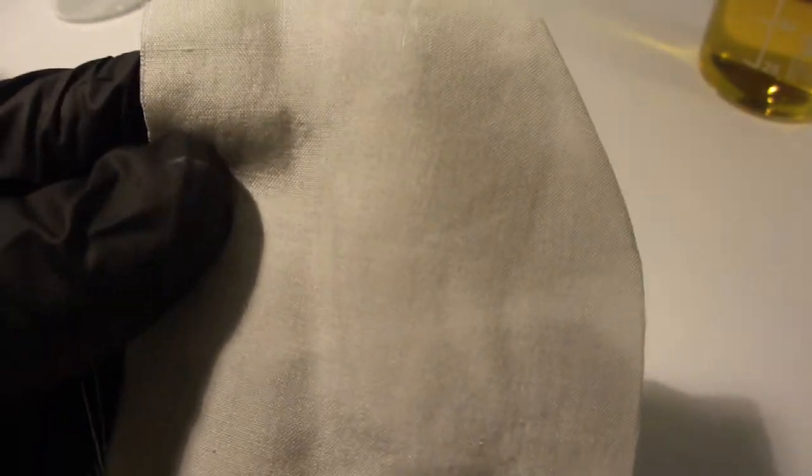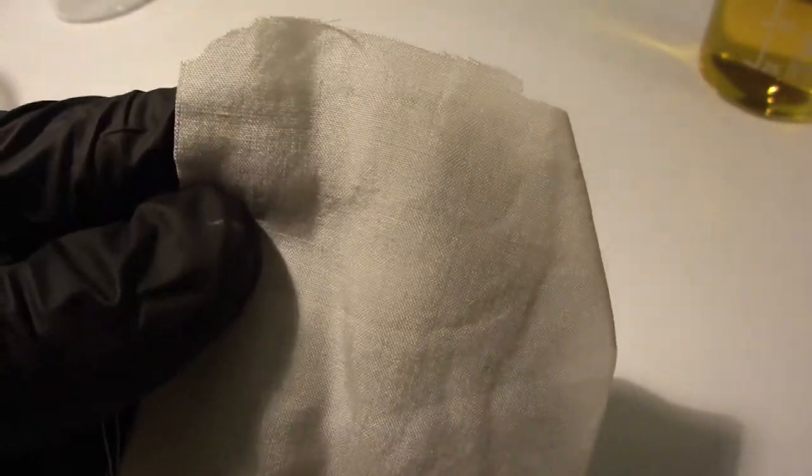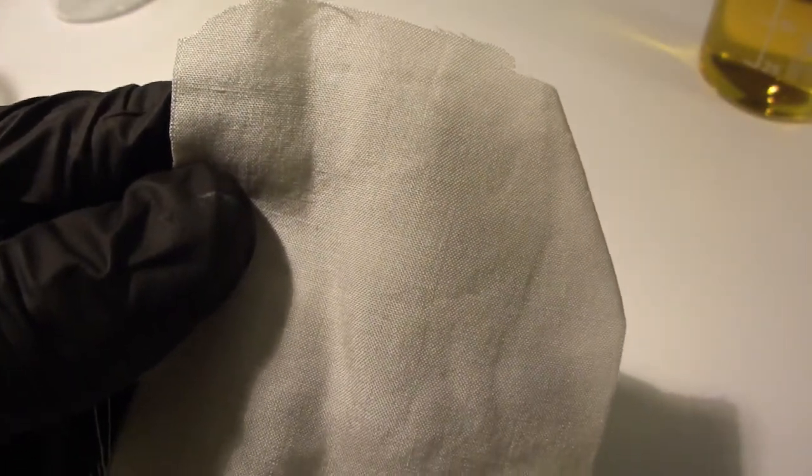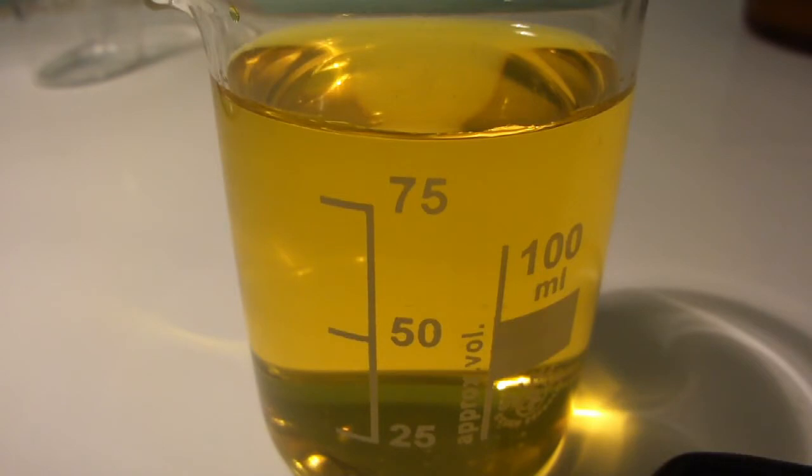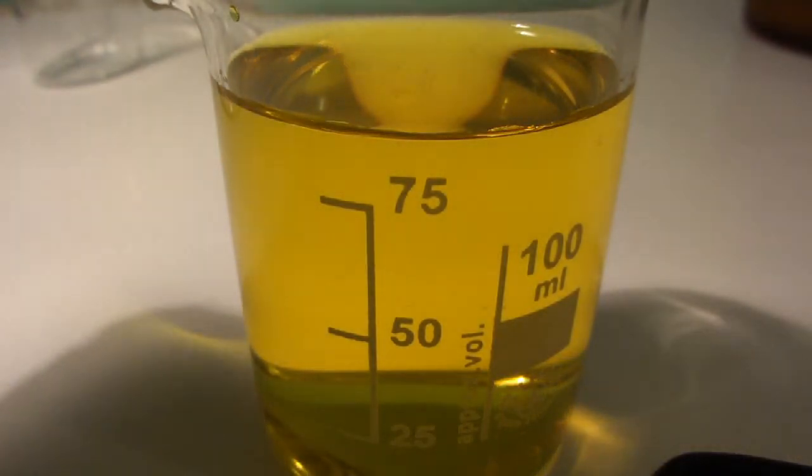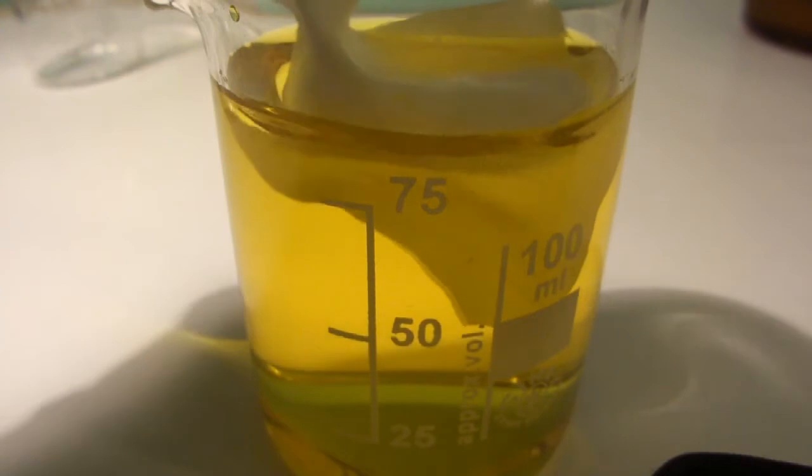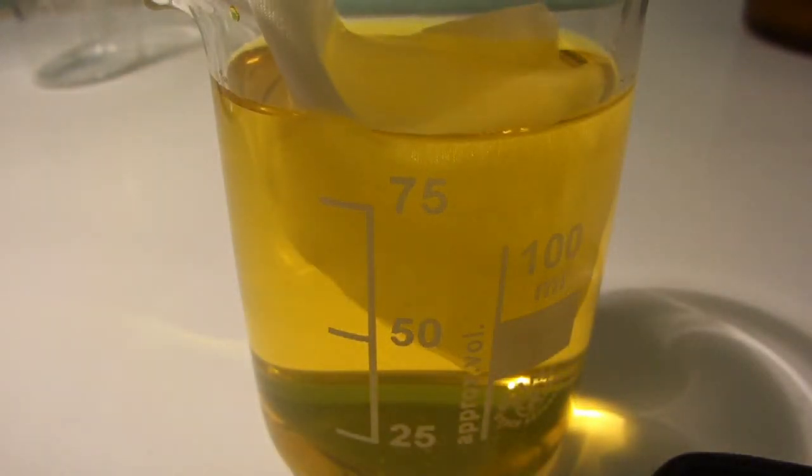So here is a piece of genuine silk. Let's dip it into the picric acid solution. As you can see, its color will turn to a bright yellow. The color is permanent and you can wash the silk as often as you want afterwards.